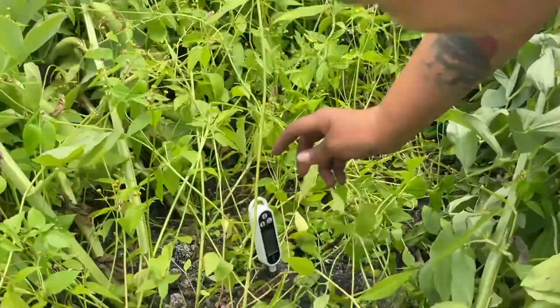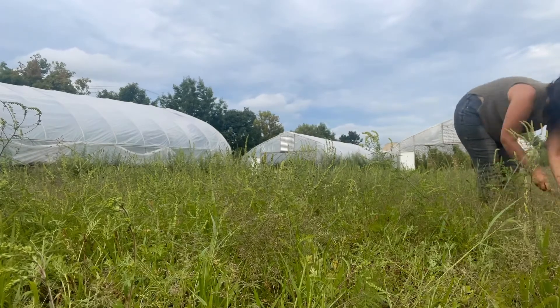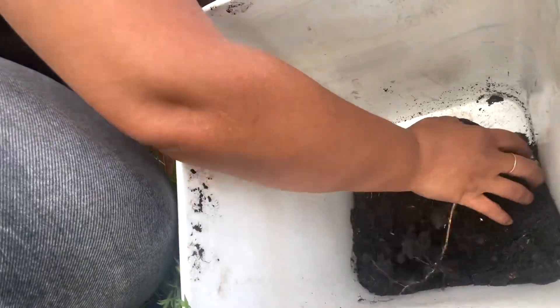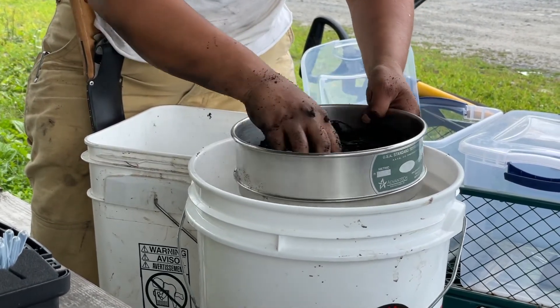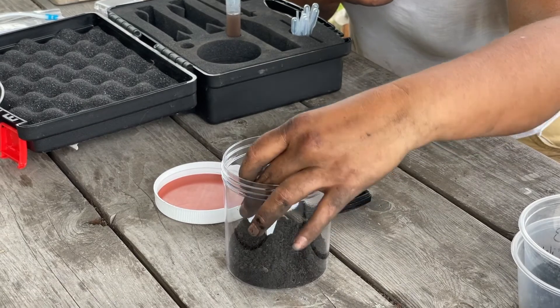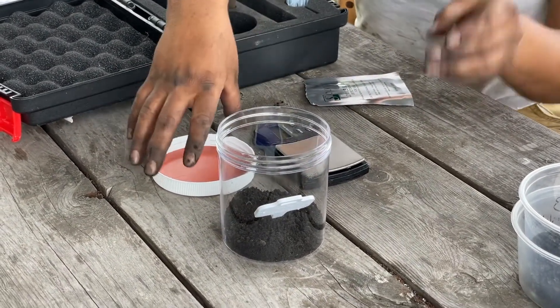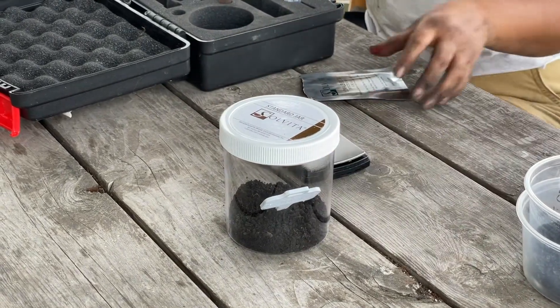Record the soil temperature at each sample site. Using a soil knife or trowel, collect multiple small soil samples from an area that represents the same soil type and management history — take at least three samples. Gather the soil from about a four to six inch depth and combine in the bucket. Handle carefully, trying not to crush or grind the soil. Gently sieve the soil to remove rocks, roots, or other debris. Measure 90 grams of soil using your kitchen scale. Open the foil pouch and without touching the gel surface, insert the test probe into the soil in the jar. Screw the lid onto the jar and record the start time. Keep the jar at roughly 70 degrees Fahrenheit. Temperature control is important to maintain since it impacts the activity of the soil microbes.